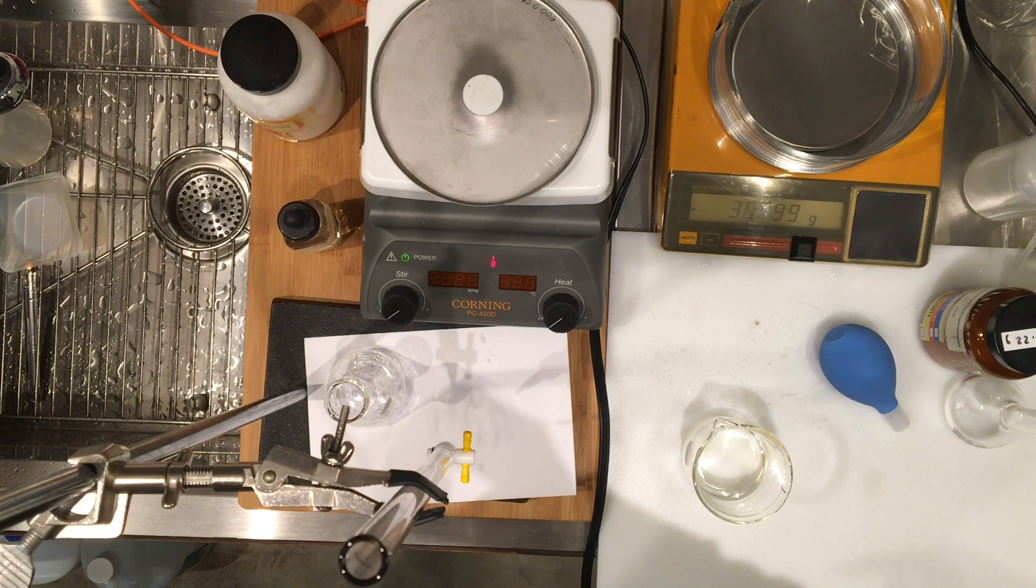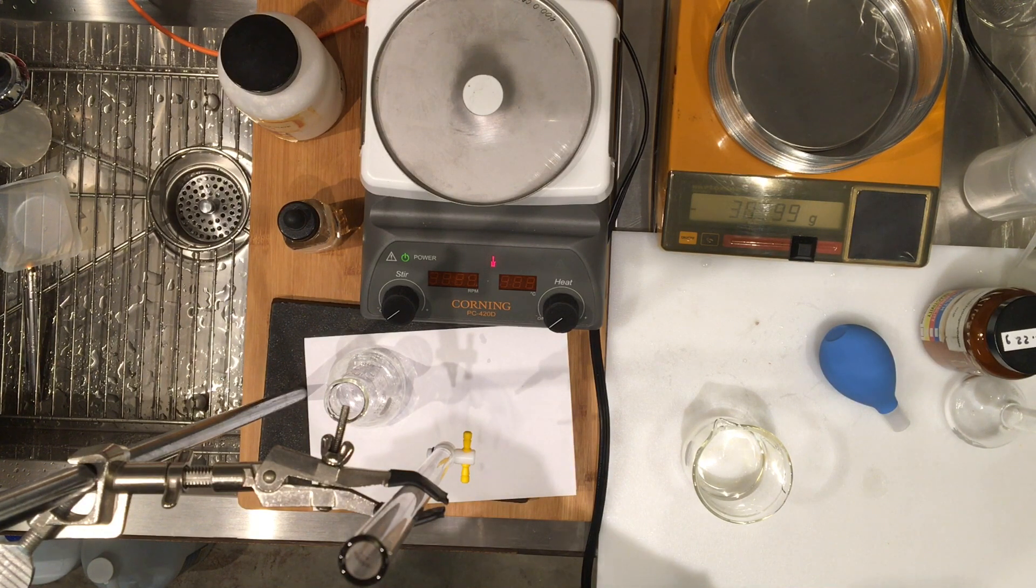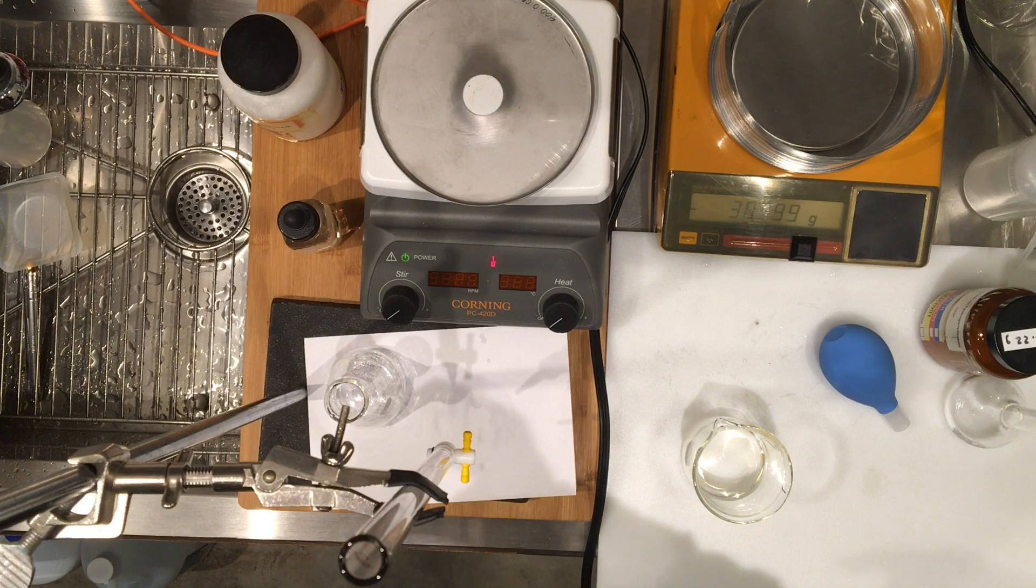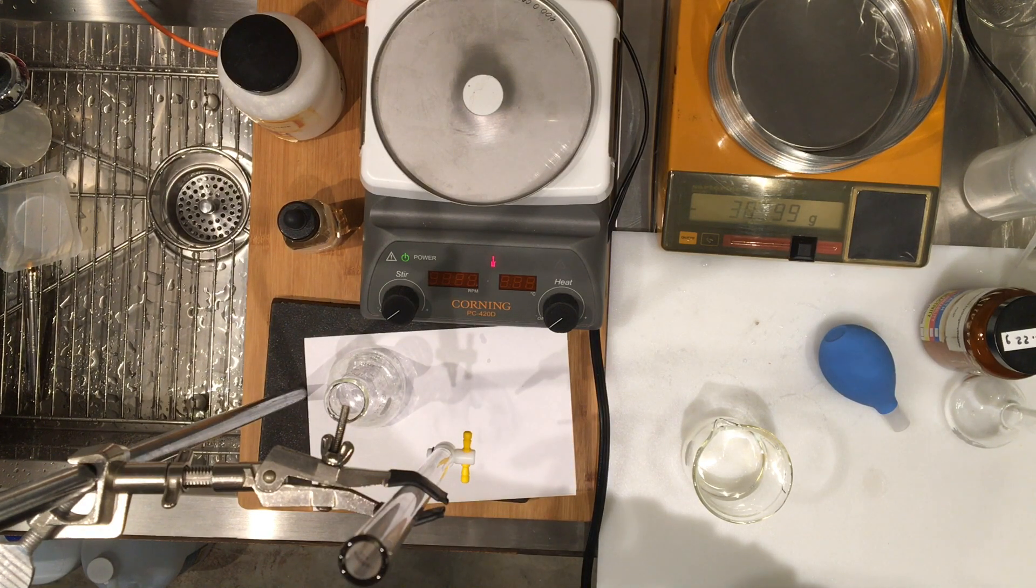So please record in your lab notebooks for the volume 20 milliliter of this vinegar from this particular brand. Maybe every brand is a little different, but this is the brand that I have, and we'll figure out the concentration.